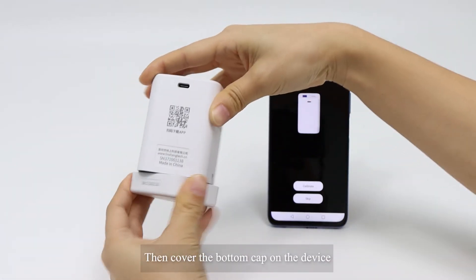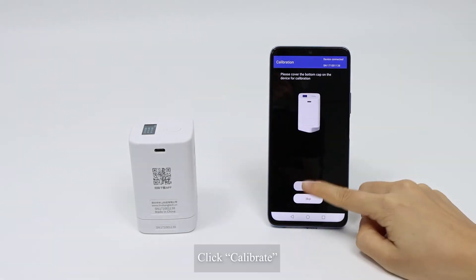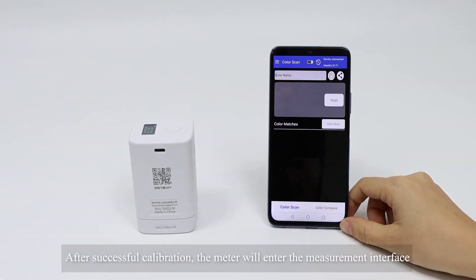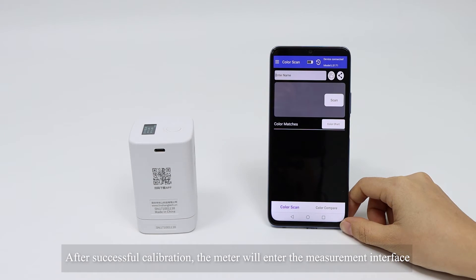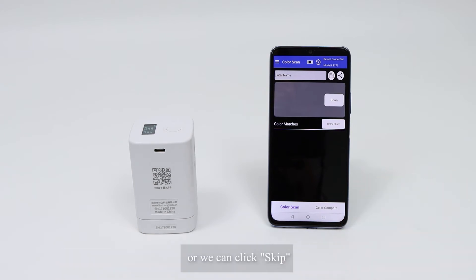The meter then enters the calibration interface. Cover the bottom cap on the device and click Calibrate. After successful calibration, the meter will enter the measurement interface. Alternatively, you can click Skip.